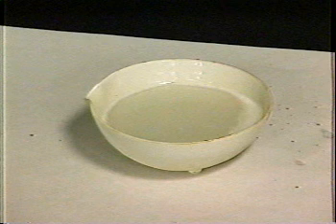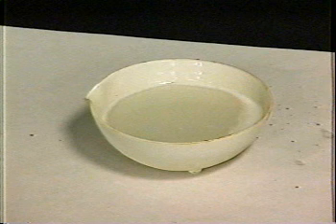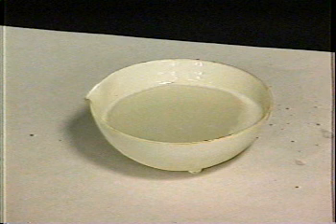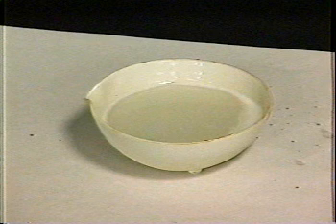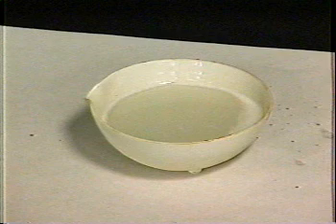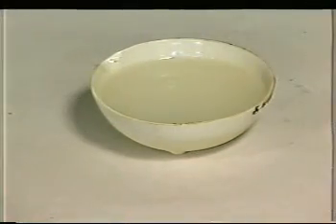Now I want you to compare that with what you're going to see next. In the next part of this demonstration, we're going to do the same reaction, but we're going to use sodium rather than lithium. Now sodium's a group 1A metal just like lithium, so you expect essentially the same chemistry to occur. However, it's lower on the periodic chart. That means its ionization potential is lower, and that leads to a rather dramatic difference. Okay, here we go.